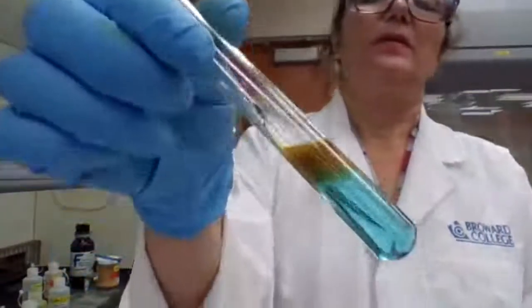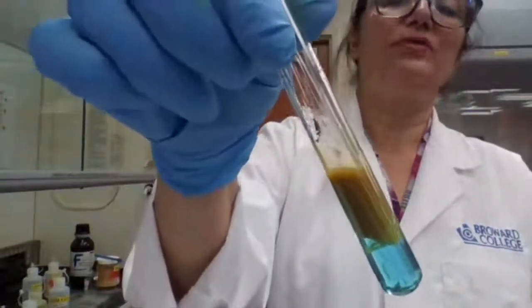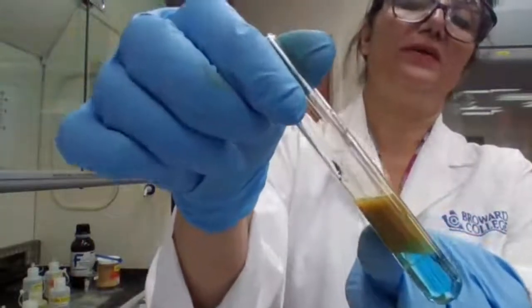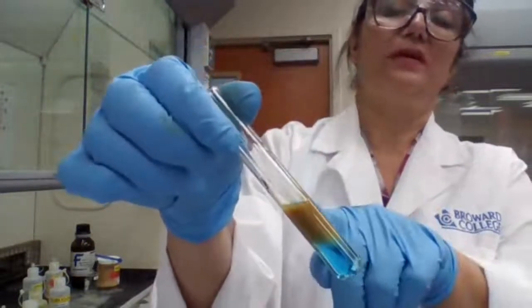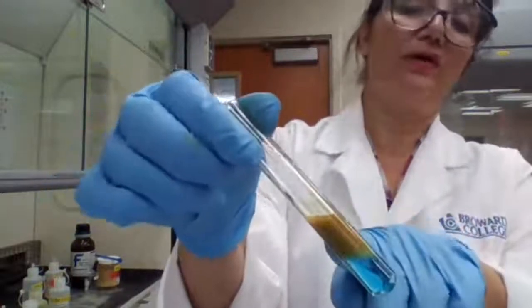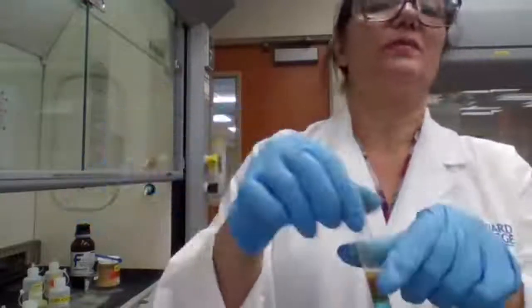So you see that new color, the maroon color; record the color in a way that you recognize it. A precipitate formed because it's cloudy, and that is the new maroon color that you have. So you record this because when you see the unknown, if you have copper, that's the color you're going to see. It may not be the exact same color, but very close to this color for your unknown.